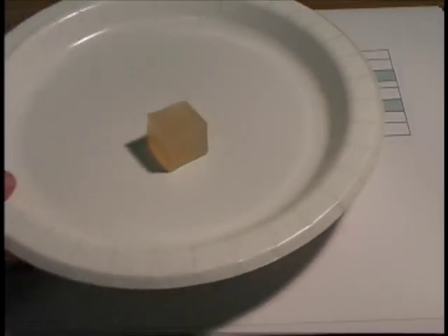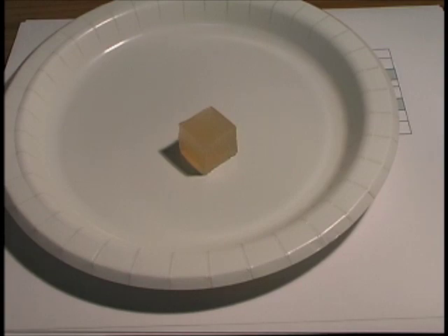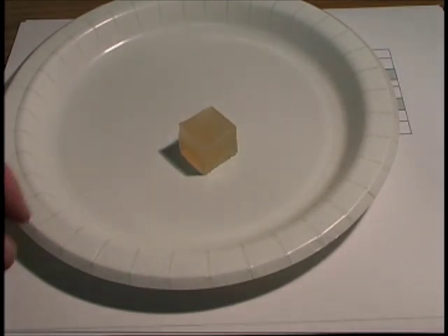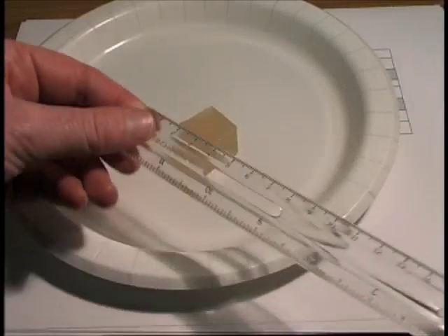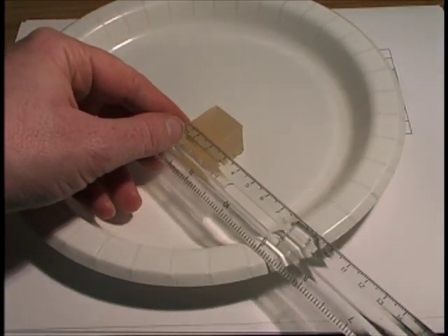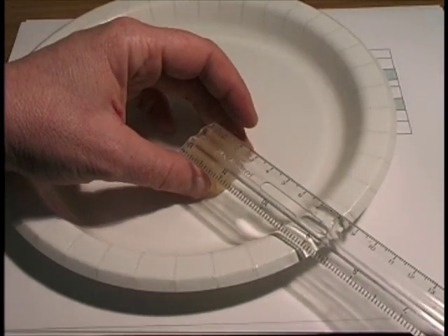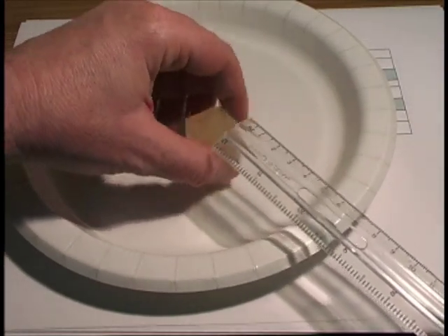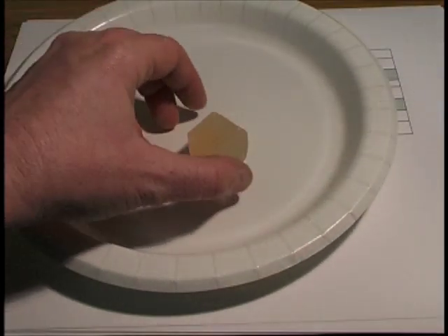Data Table 1. Before we start talking about the calculations, let's start by taking a little data. This cube has been sitting out for a couple days, so it's not pink. But we can still measure each side. It's pretty cubic — two centimeters by two centimeters by two centimeters. So it really is a cube.